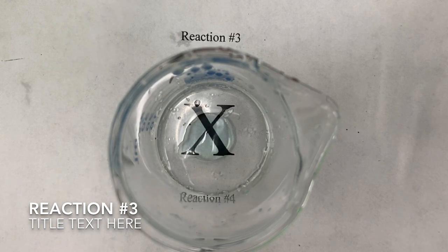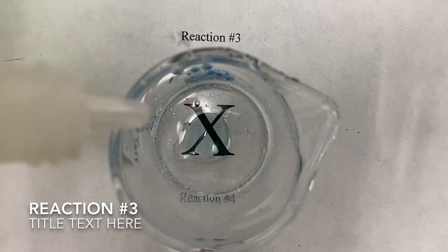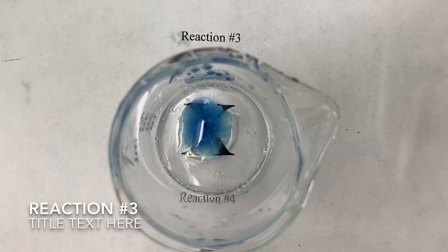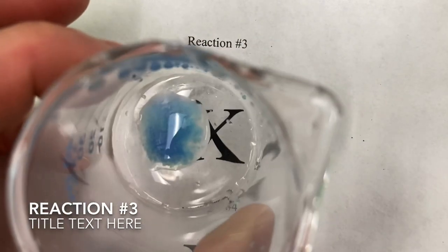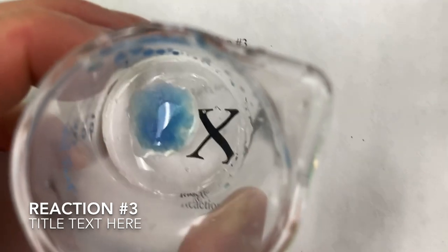So make your prediction, and let's see what happens when I add some ammonia here. Okay, so not only did it change colors, if we look closely here, we can actually see the formation of a precipitate.